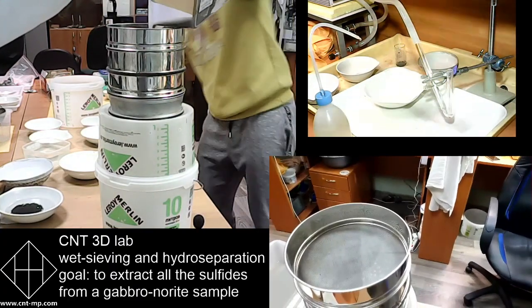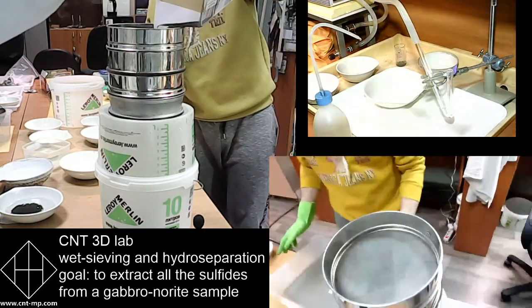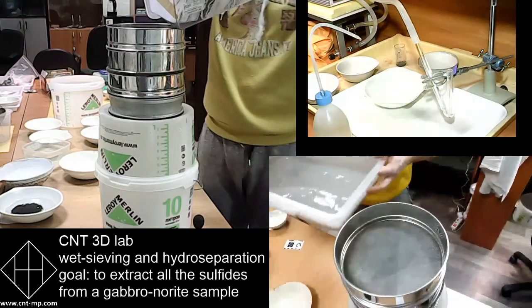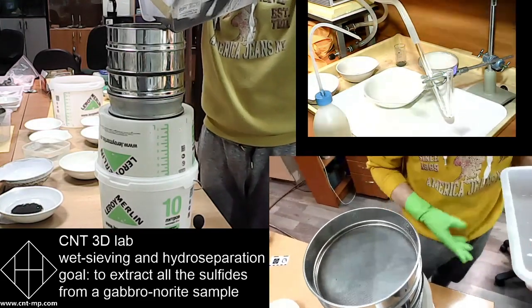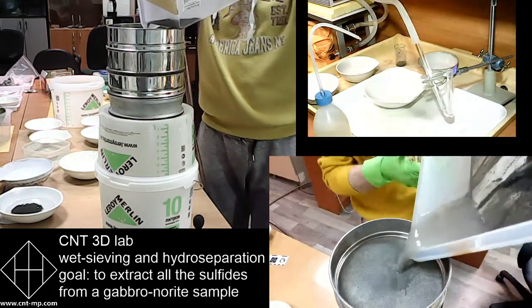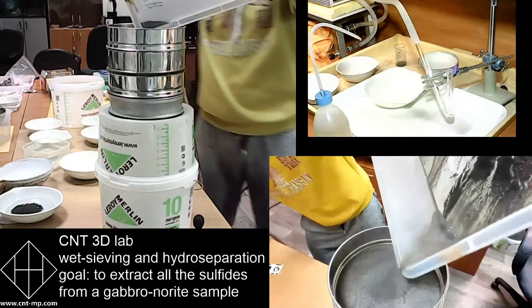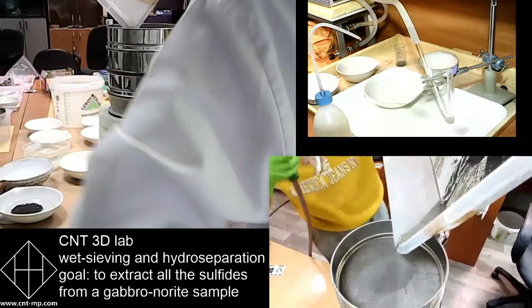So what Oleg does, he brings the whole tray up, I think. Yeah. And just pours the whole set with the same sample. There's a little bit of a delay, which is good in a way.